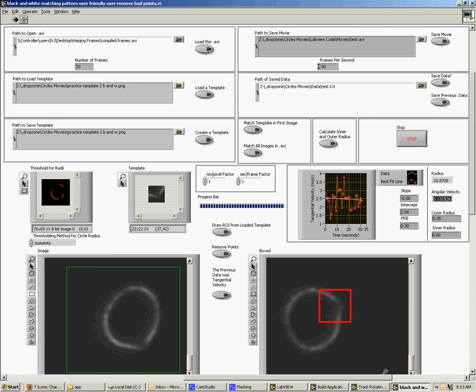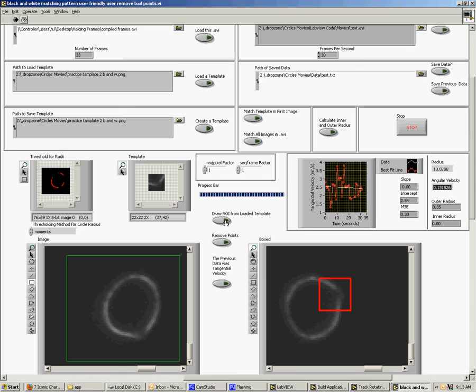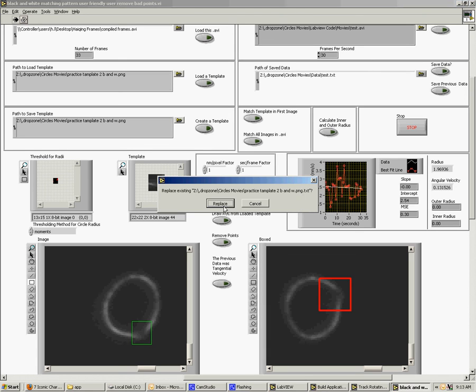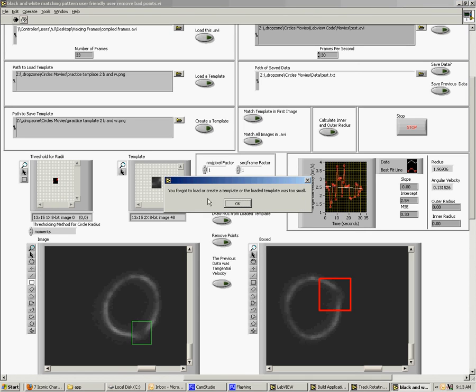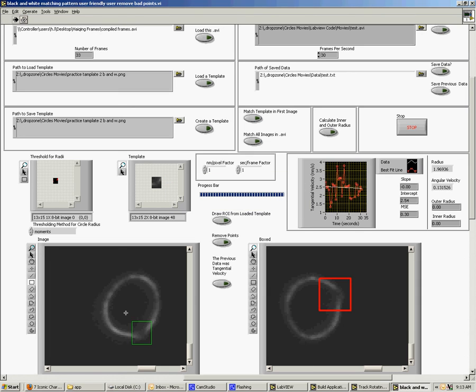Now I've also added in this draw ROI from the loaded template. If you click this, it'll draw the ROI from whatever created this template. I found this very convenient when I was debugging. Now, real quick, when you want to watch a point moving around the microtubule, a problem you have is if you make this template too small and you click it, an error message might come up that says you forgot to load or create a template, or the loaded template was too small. So it wasn't enough information for it to actually match, so you have to make sure it's sufficiently large enough.